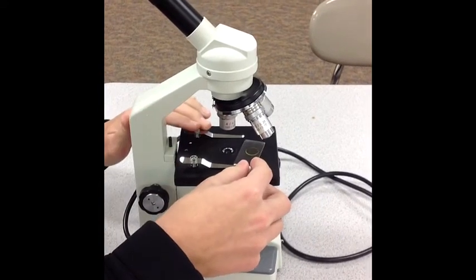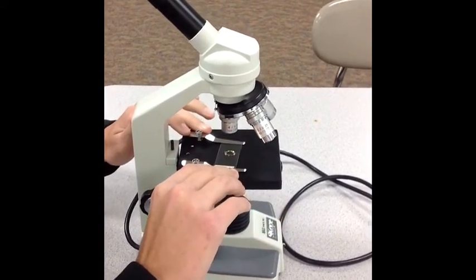When you are putting the slide on, always make sure both clamps are secure on the slide.